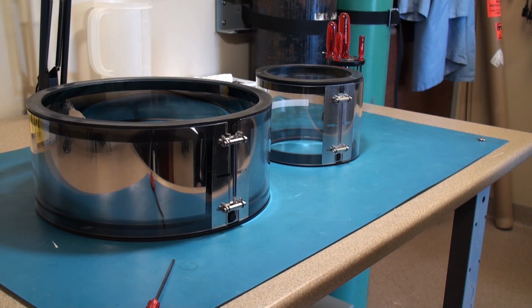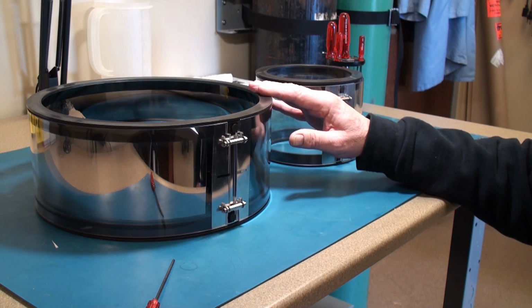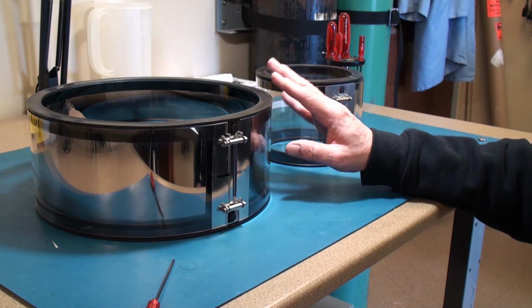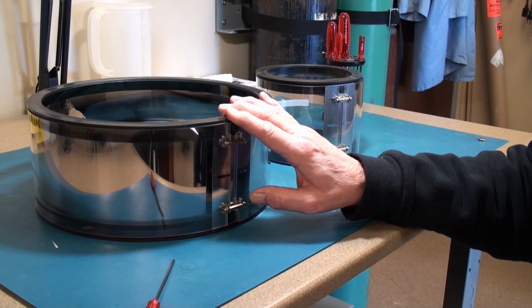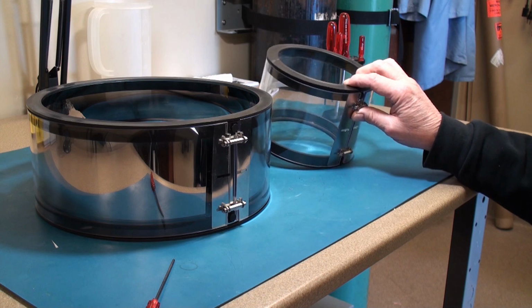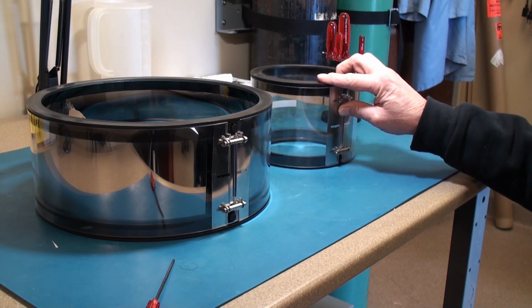Hello, today I'd like to show you how to change the flat L gaskets on the glass cylinders on the Q series coaters. Here we have a 300 millimeter chamber for a Q300 series. Here we have a Q150 series glass cylinder with L gaskets.